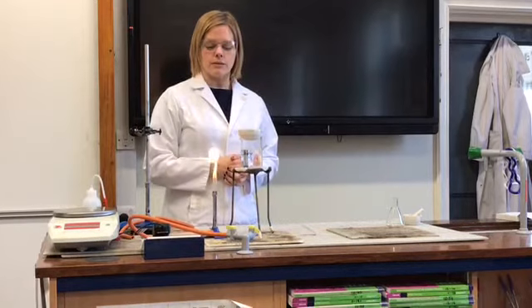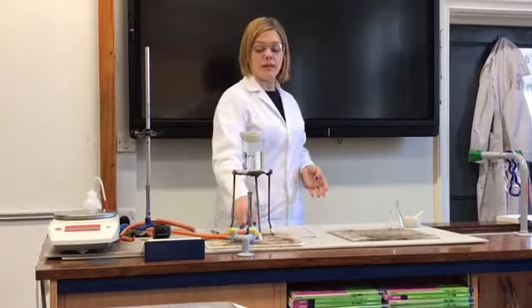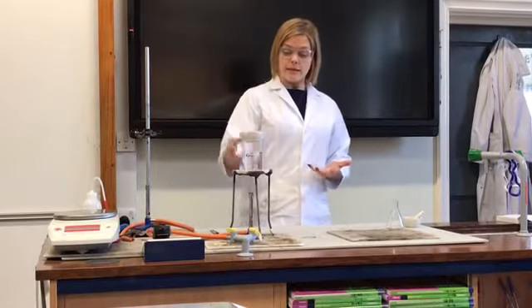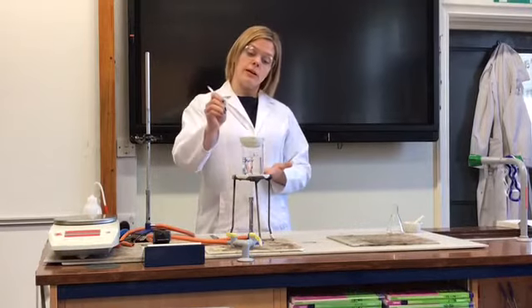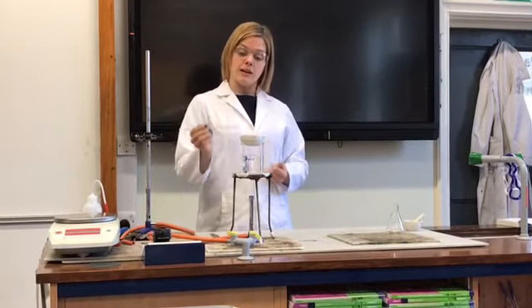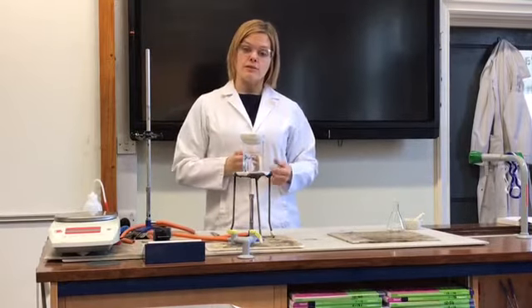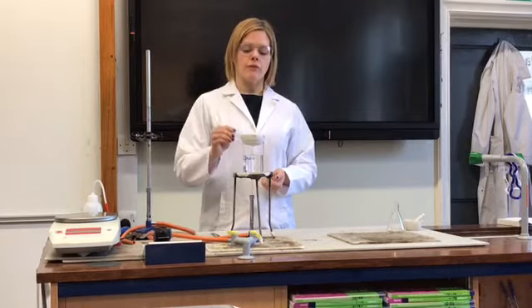Essentially what happens here is we're taking a water bath—this is just a beaker with hot water in it—heating that up, boiling that away. When that boils, the steam will heat up, will contact with this evaporating basin, and will itself cause the solution inside the evaporating basin to heat up. Eventually we should be able to drive off the solvent from this solution.